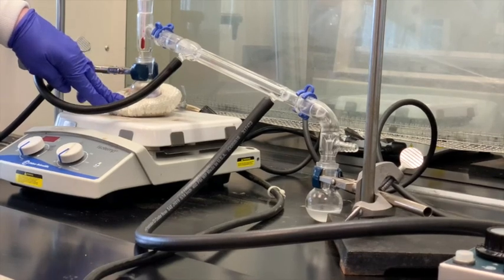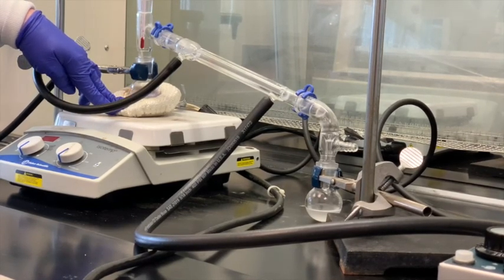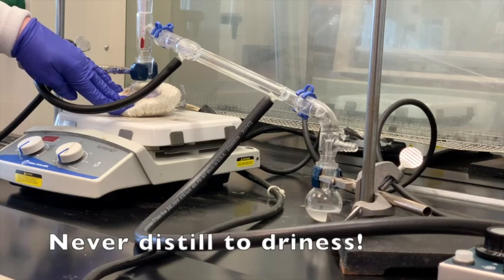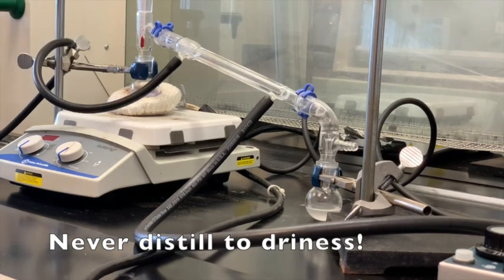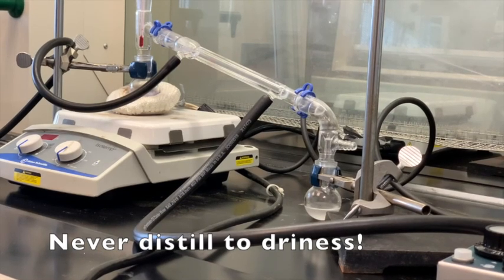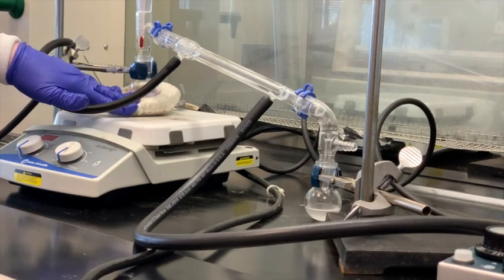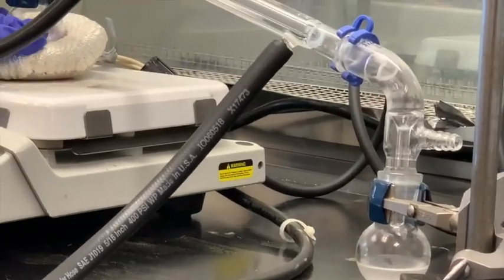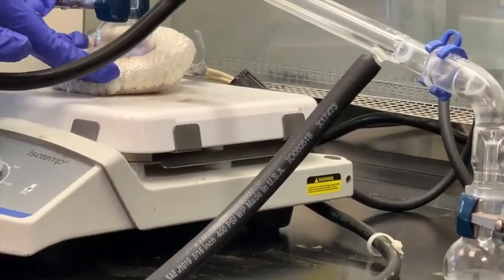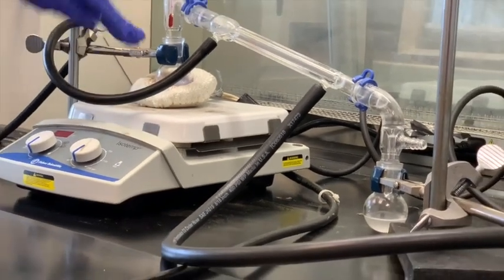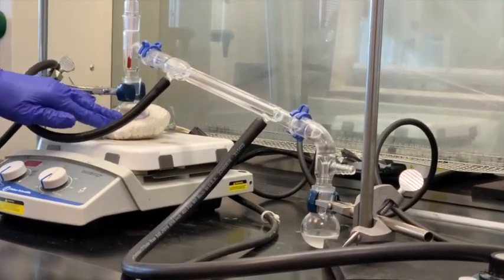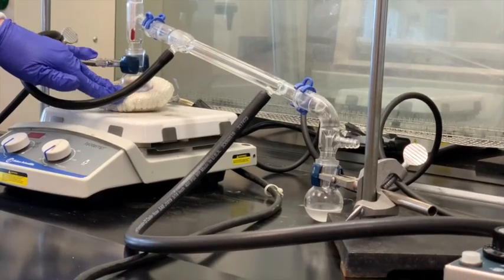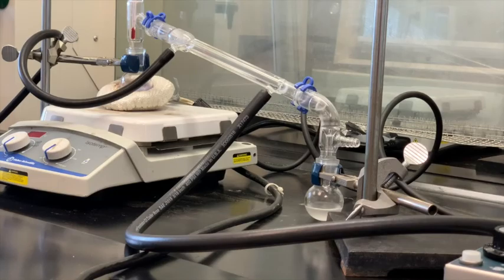I just want to re-emphasize this. I don't think I mentioned this before, but whenever you do some type of distillation, you never really want to distill to dryness. If that happens, there's a couple reasons for that. Sometimes there's some chemicals that may contain impurities, and if those things, such as peroxides, when they get dry, they can actually become somewhat explosive. So you never want to distill anything to dryness, plus the fact that if there's nothing in there and you're heating something that's dry, typically that flask does have the capability to crack. You don't need much. Looks like there's at least a couple mils in there, and there's always going to be some stuff that may be condensing back down, so you don't need a lot of material left in here, but it's better to err on the side of caution to stop it before you think you need to.